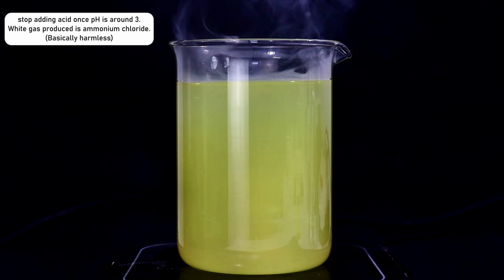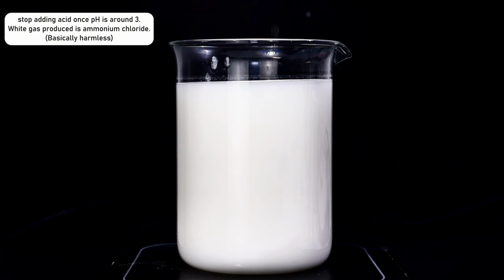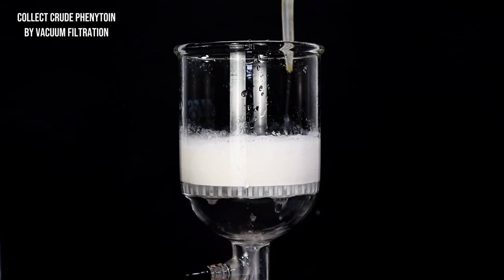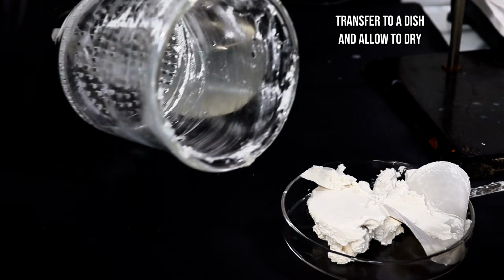While this gas might look scary, it's caused by the gas phase reaction of hydrochloric acid and ammonia, forming ammonium chloride. Ammonium chloride is pretty much harmless, and the source of the ammonia here is the hydrolysis of the urea I used earlier. I then collected the crude phenytoin in my Buchner funnel, rinsed it with cold water, and then transferred it to a dish to dry.